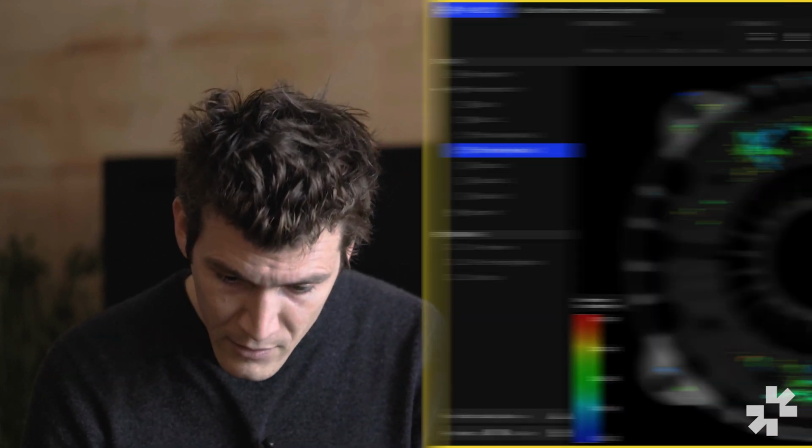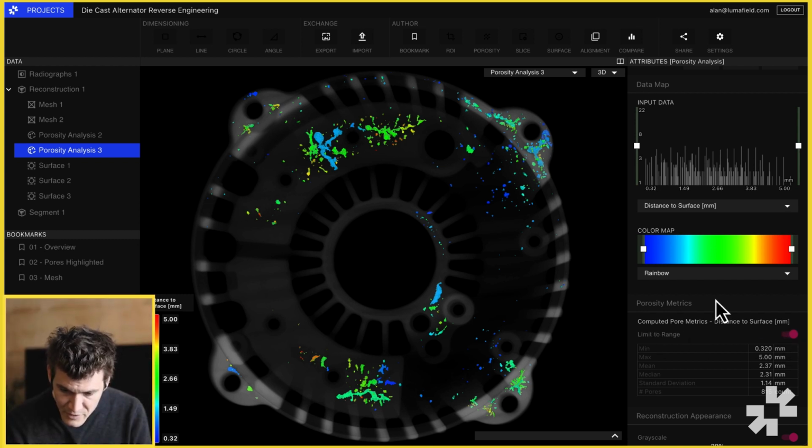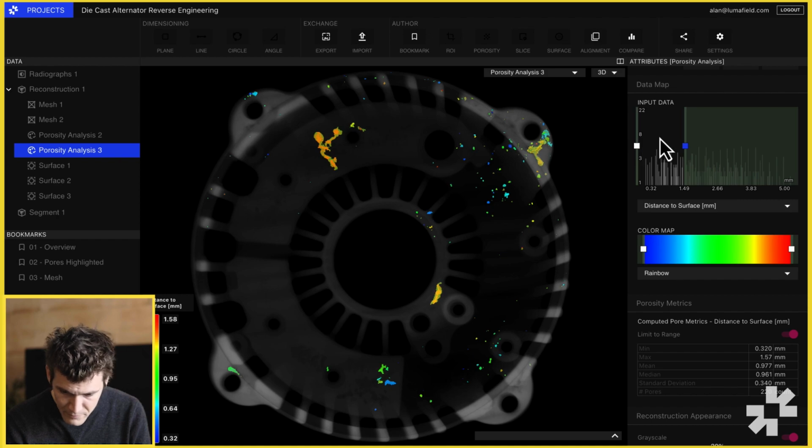Sometimes it's useful to just calculate aggregate metrics on a subset of your pores. If I toggle on limit to range for my computed pore metrics, as I drop this threshold down, you can see that the aggregate metrics update based on what's selected in the UI.